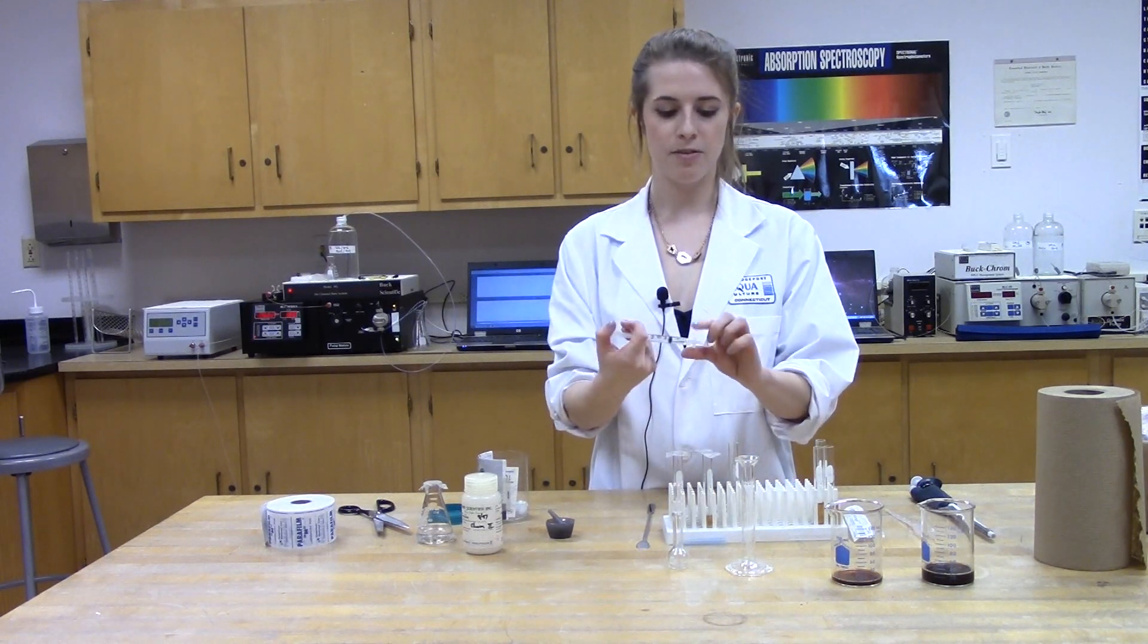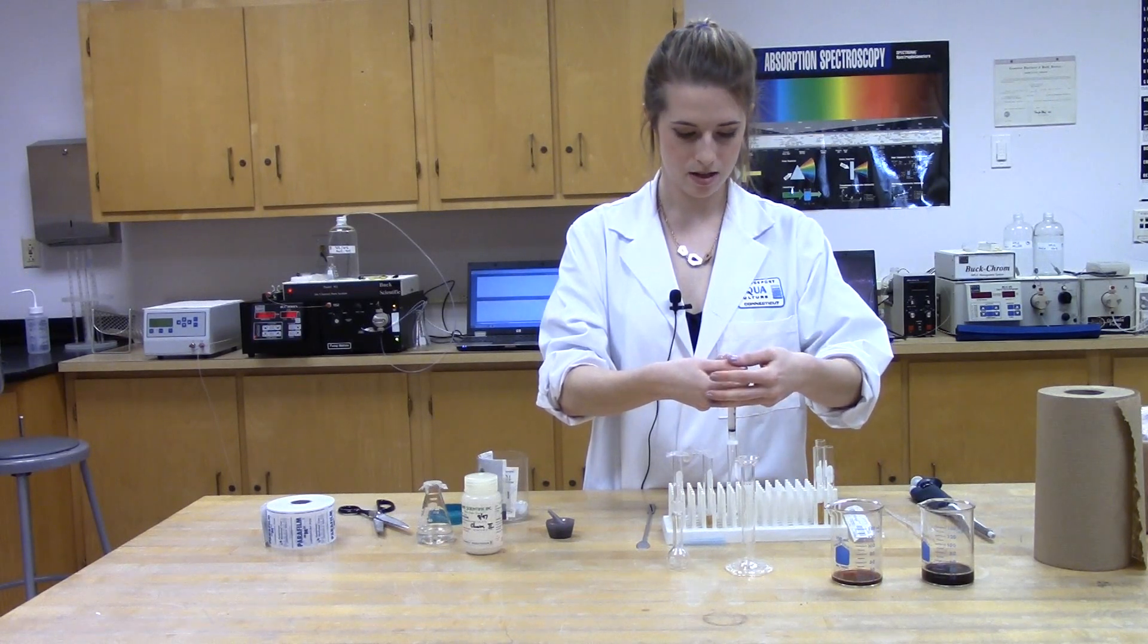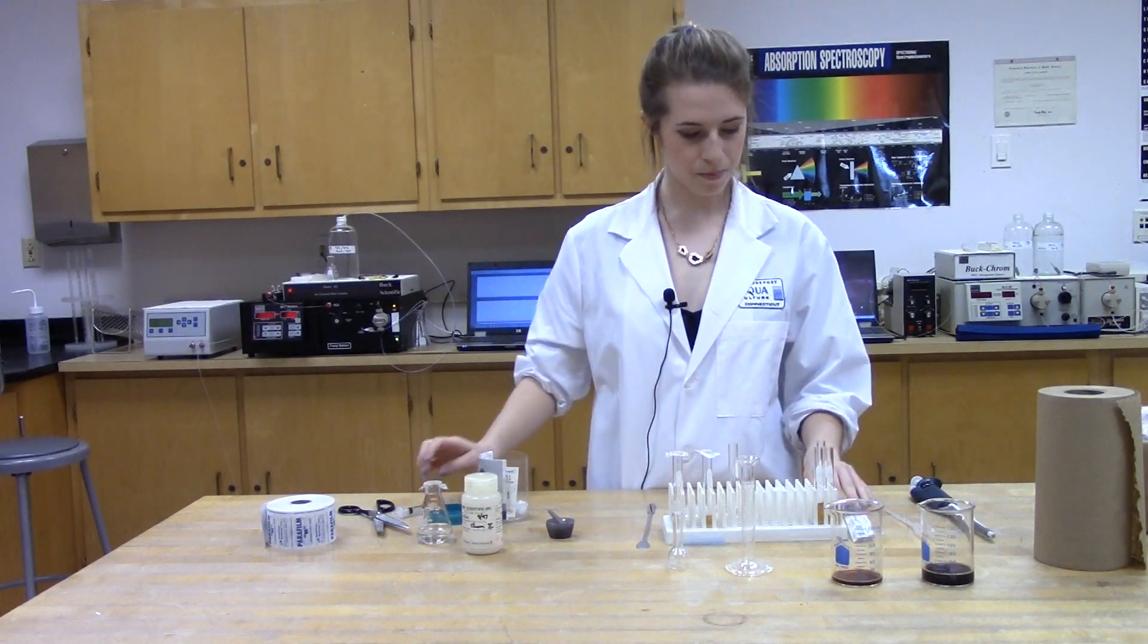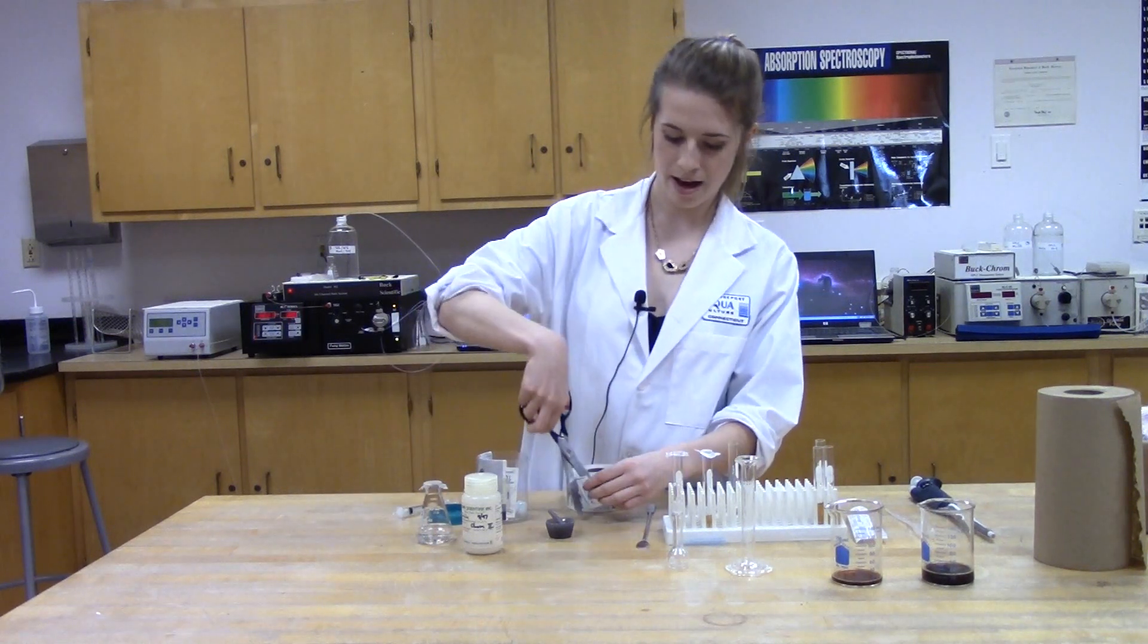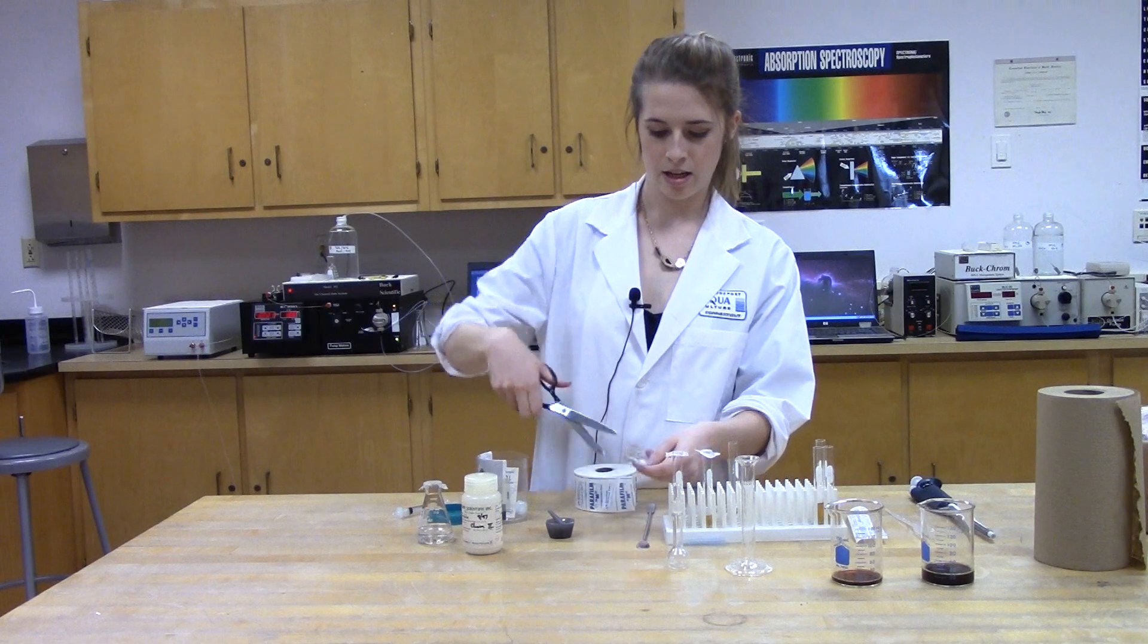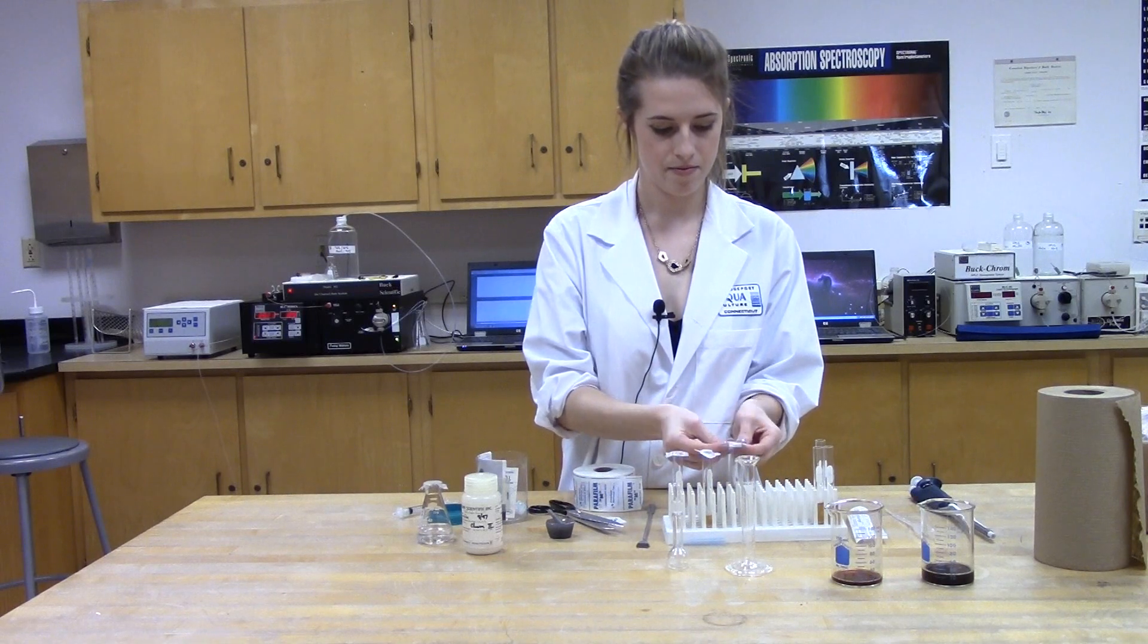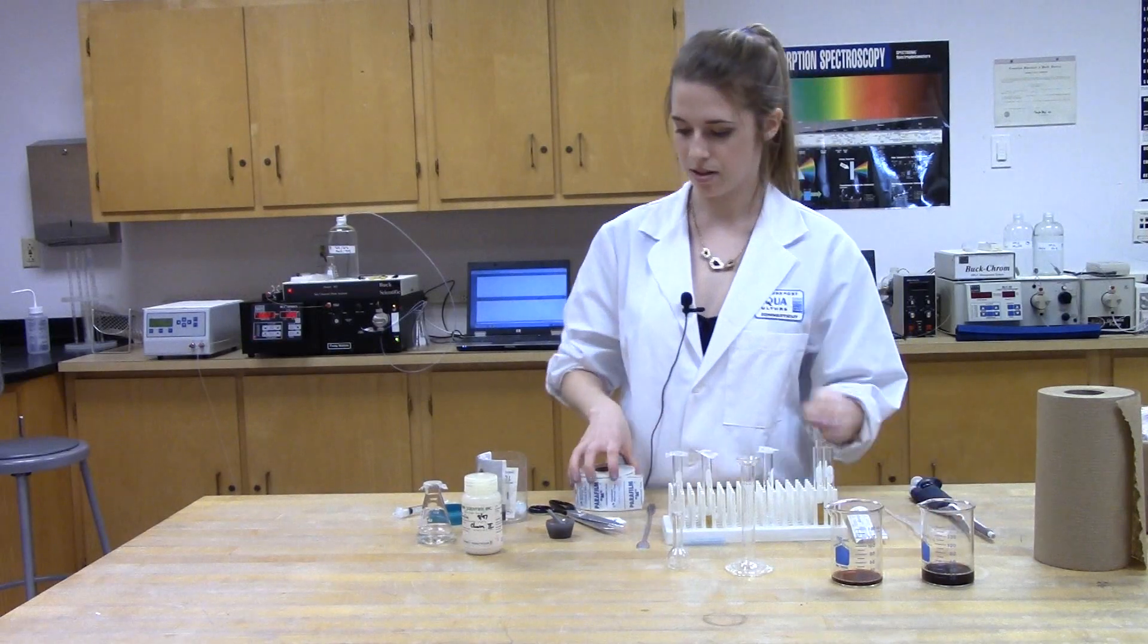So you really need to only get about one to one and a half milliliters. Next, you attach the filter and start pushing it through into a new test tube. Once you filter it, it's important to cover it right away to keep that pureness and high quality you just gave it. So now we have our pure standard to compare the other samples against.